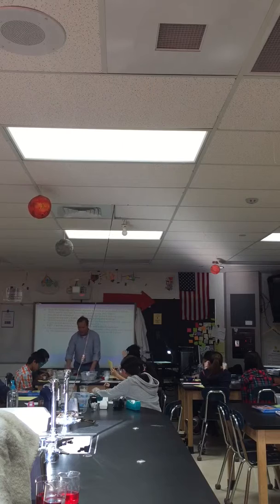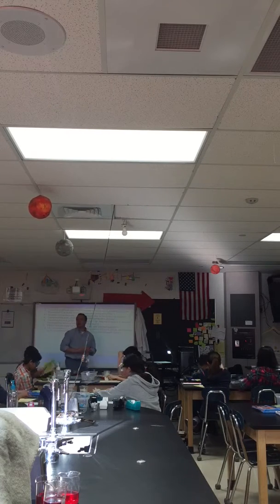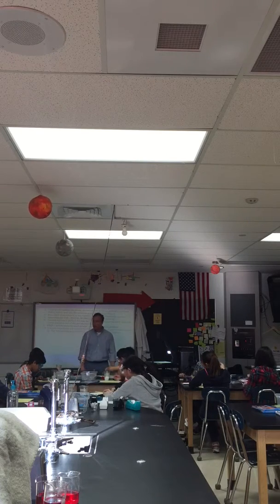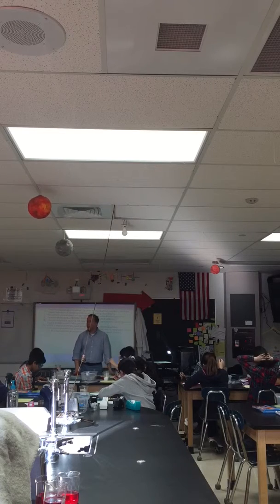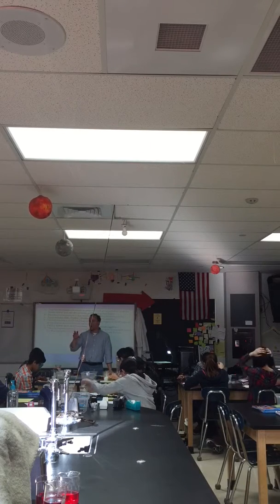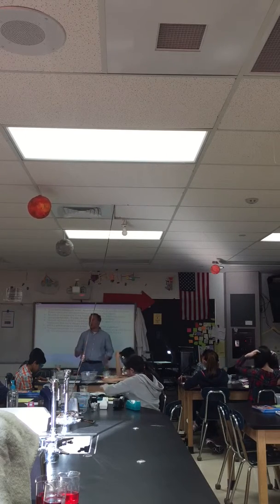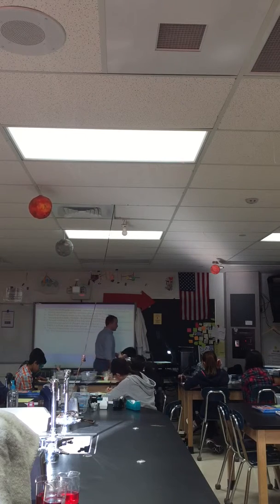I'm going to go over test 1 real quick. Flip it to the back. There are 10 different tests that you can complete. Of those 10, everyone is going to do number 1. The other 2 bags are on you and your partner. Whichever test, 2 through 10, you want to do, go for it. You will record your observations based on the test that you performed with your partner.